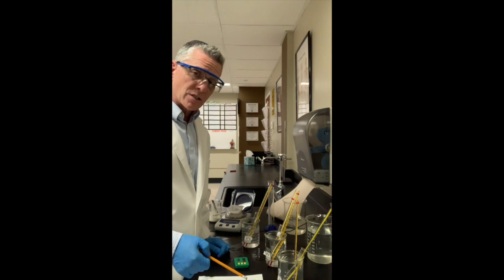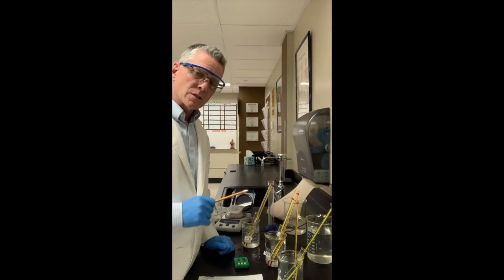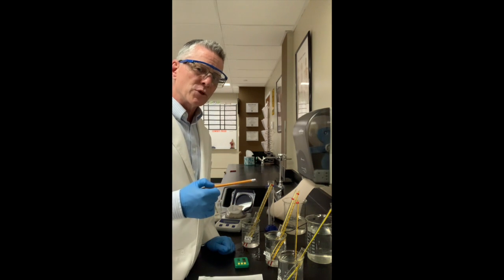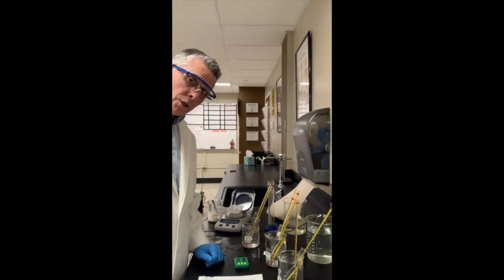My temperature is 37.5, which is body temperature. I'm going to wait 1 minute, record this. I will put this on pause, but you can trust that I will record this temperature every minute for the next up to 20 minutes or until we get the same temperature 3 times. It's like watching paint dry, watching water boil, watching grass grow.